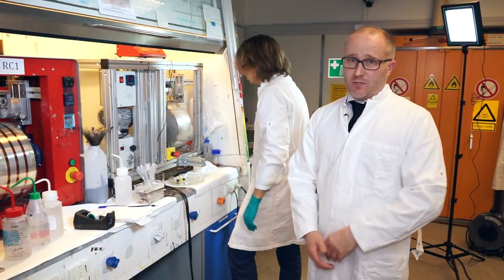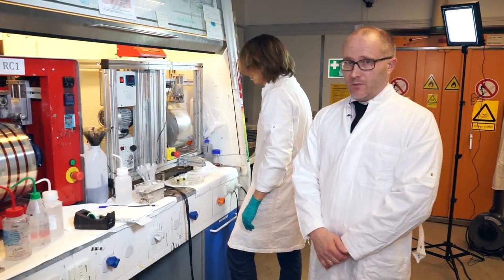You'll notice that all the processing is done here in a fume cupboard and under ambient conditions.